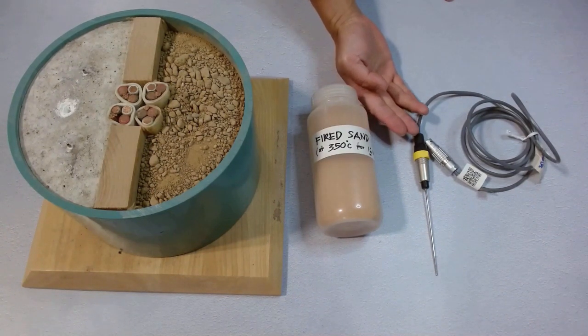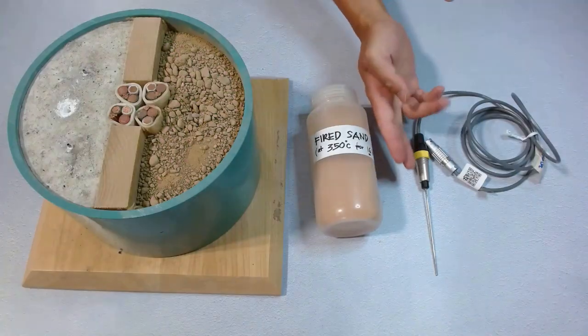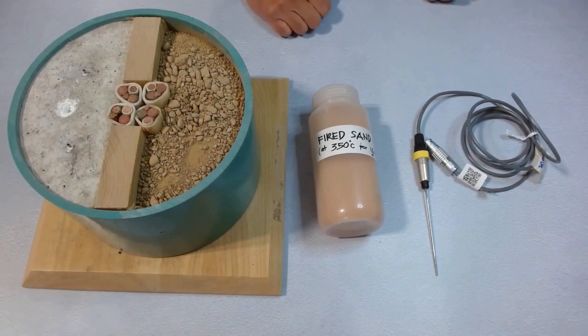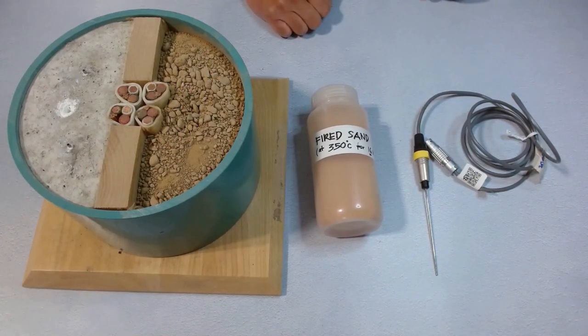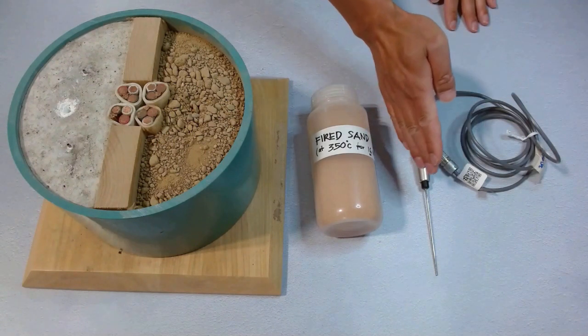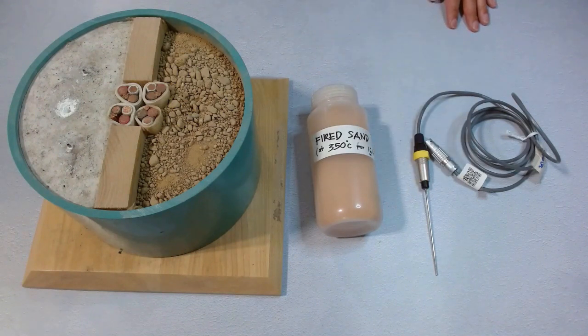This is a TLS100 needle sensor. It is 100 mm long and only 2 mm in diameter. There are precision sensors buried in the needle tube, so the wall is really thin and you need to be very careful using it in case it gets damaged.